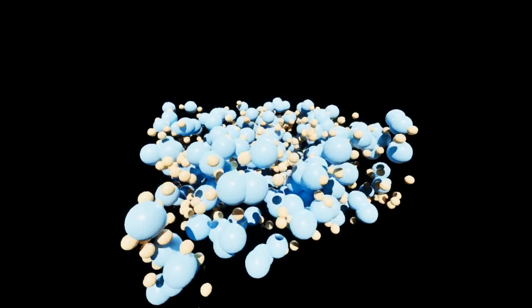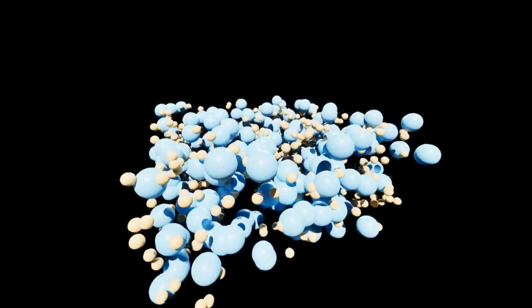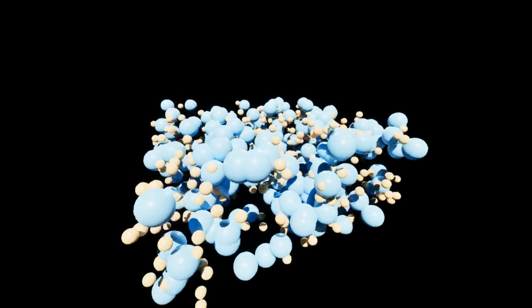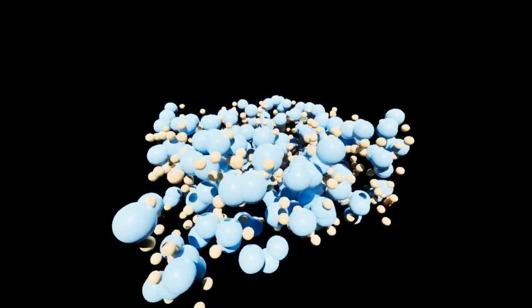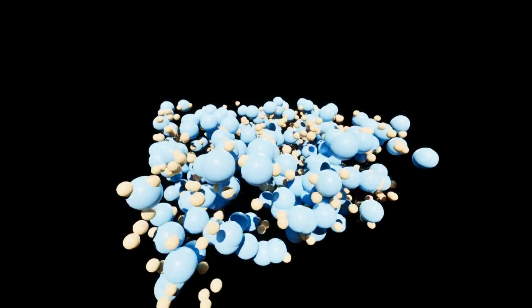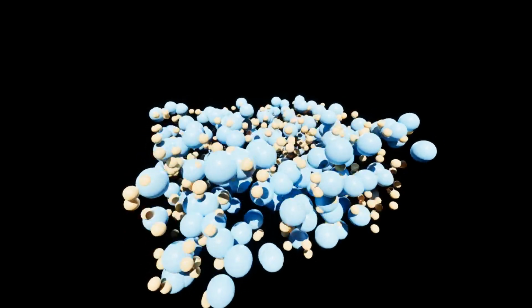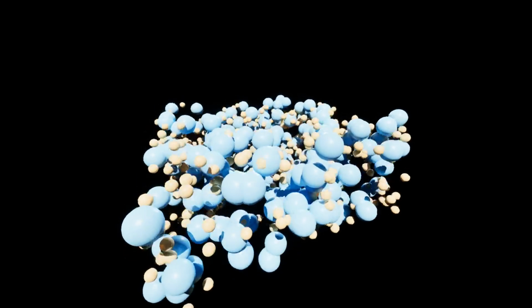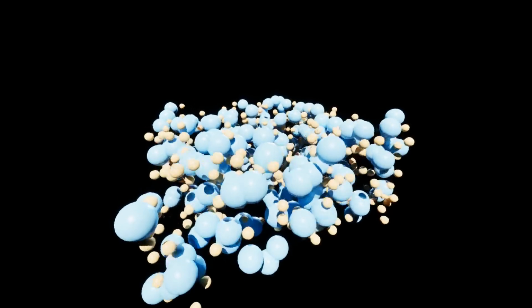The cartoon representation needs to know where the helices and sheets are. The plugin computes that in the engine, following the method of Kabsch and Sander from 1983. Hydrogen bond energies, N-turns, bridges, or it takes the assignment straight from the file's own helix and sheet records, if you prefer to trust the depositor.